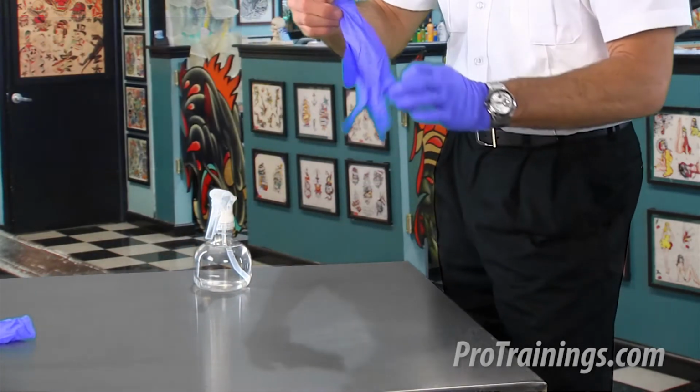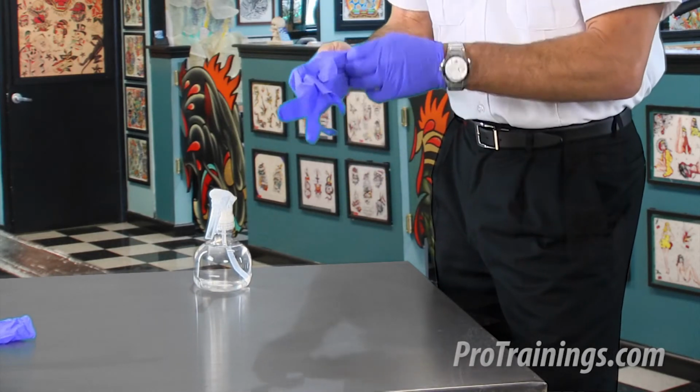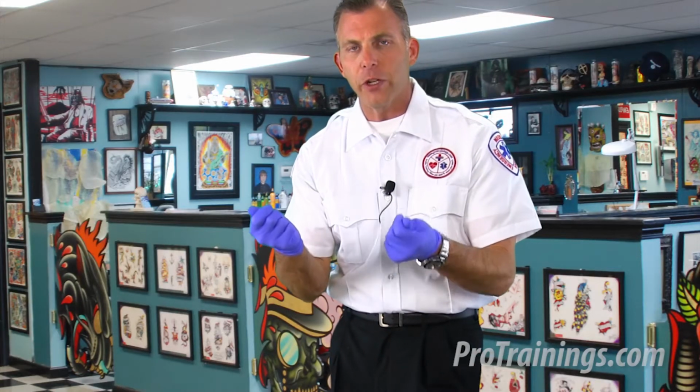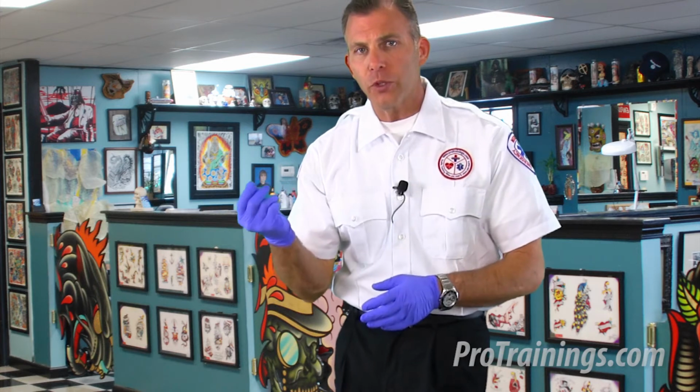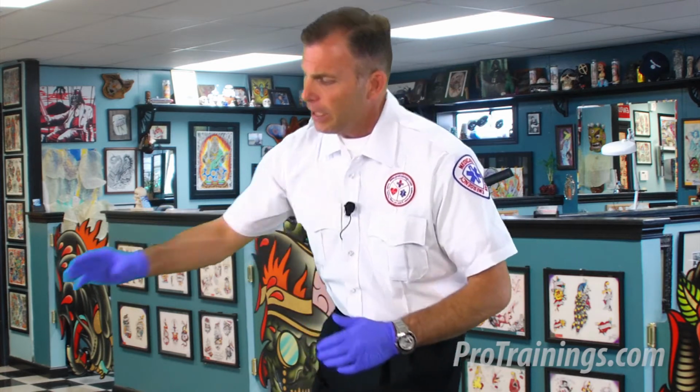You might notice these are blue gloves. These are nitrile gloves, but these are medical grade. You want to make sure that your gloves are medical grade so that the pores of the protecting barrier are small enough to protect from infectious diseases: hepatitis B, hepatitis C, HIV. Industrial grade gloves may not have that quality. The pores may be too big. They may have permeable pinhole sized holes in there. They're not graded the same as medical grade gloves. So that's a distinguishing piece you want to be careful about.